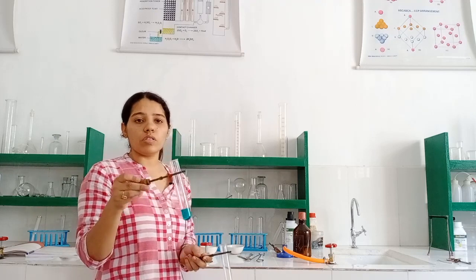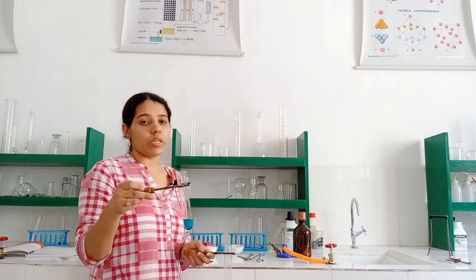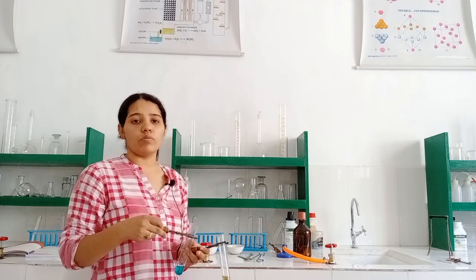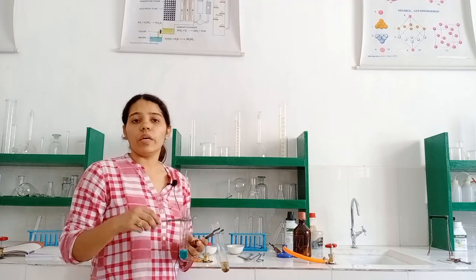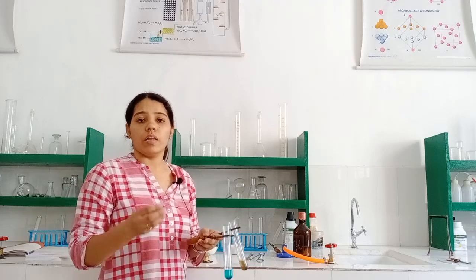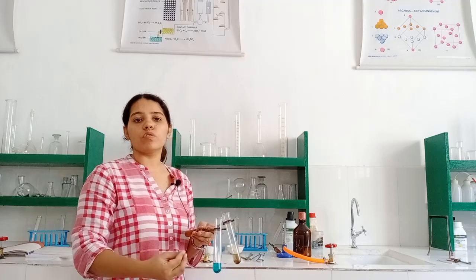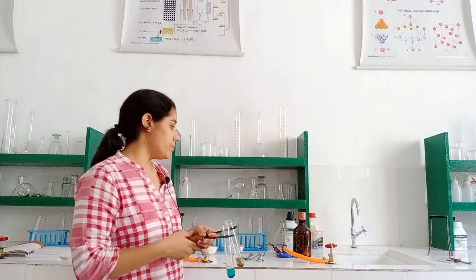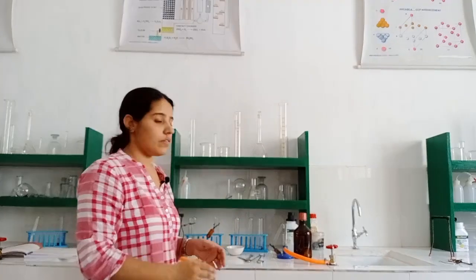Mostly we are taking the salt solution of that particular substance. And the blue color of copper sulphate is due to the water of crystallization. That means the copper sulphate has some fixed amount of water molecules in it, due to which it appears blue in color. If we heat the copper sulphate crystals, the blue color disappears, because that blue color is because of the water molecules, and when we heat the crystals, the water molecules disappear from the crystals in the form of vapors. Okay, so this is all about the iron and the copper sulphate solution.